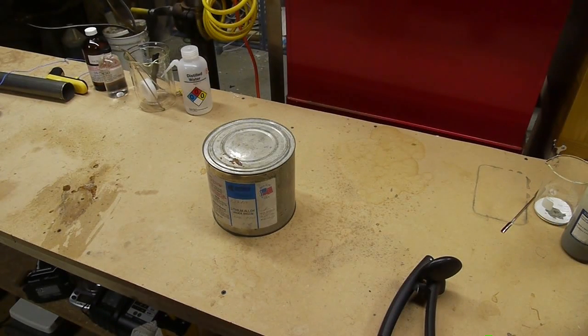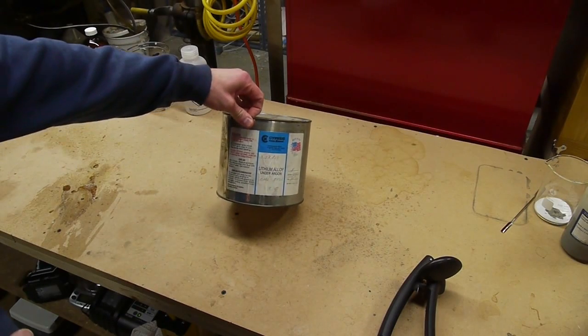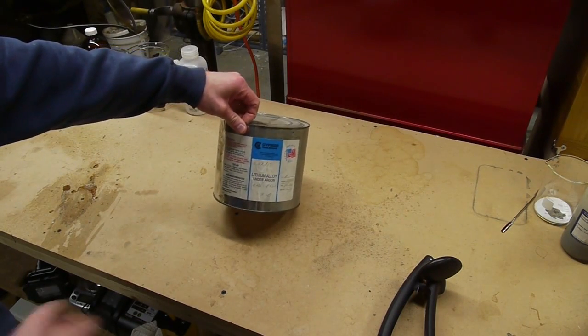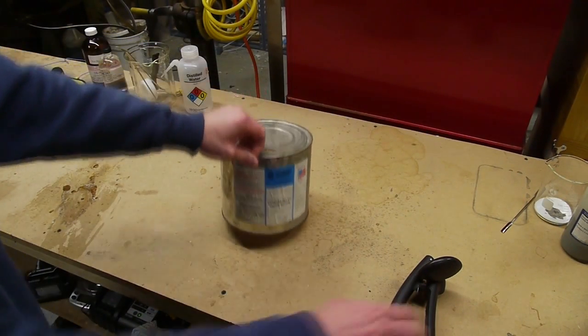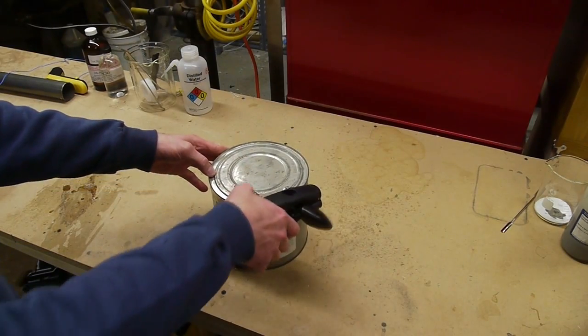Hey everyone, I recently picked up a couple of interesting items at the flea market, one of which is this tin of lithium alloy under argon. So let's crack this thing open and see what's in there.